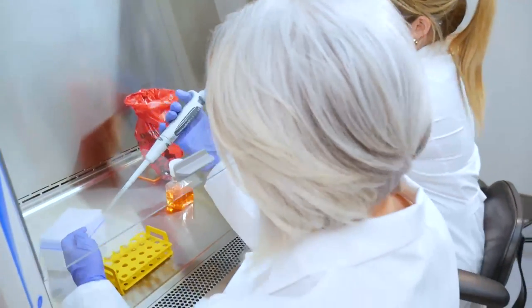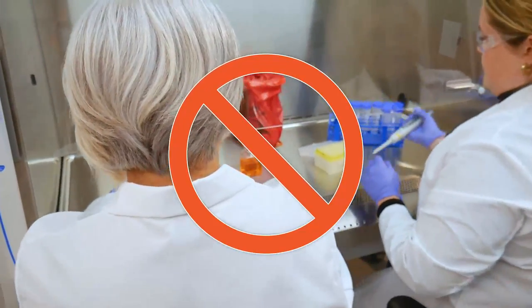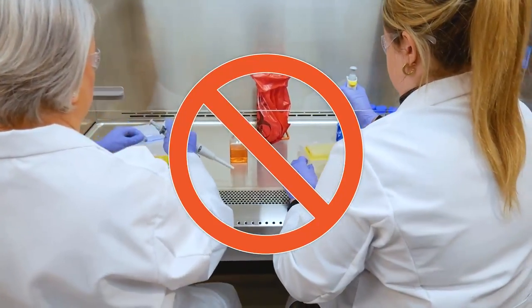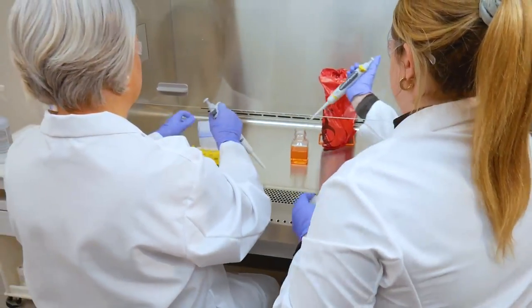Never have more than one user per biosafety cabinet. Multiple users working inside the same BSC will disrupt air flows in the cabinet and may lead to cross-contamination or worse, loss of personnel protection.